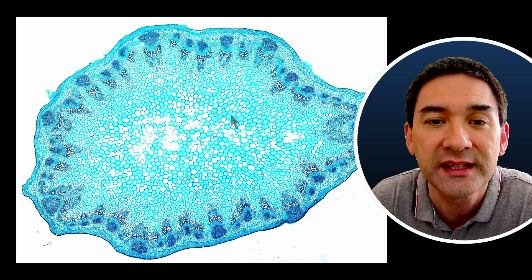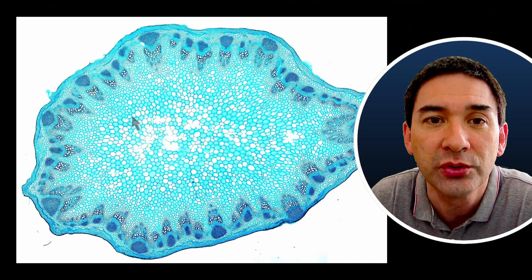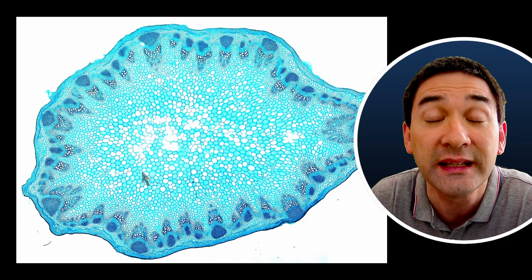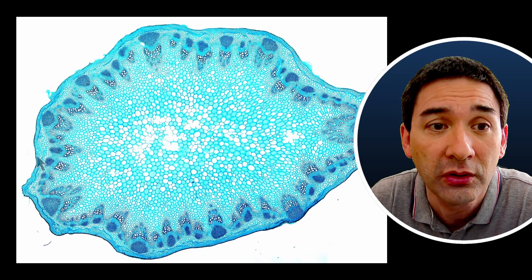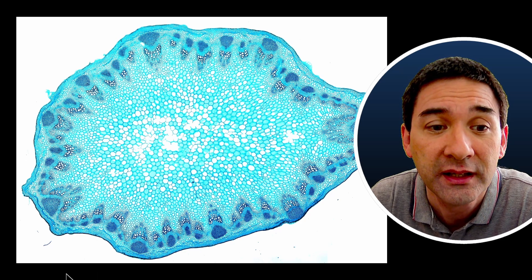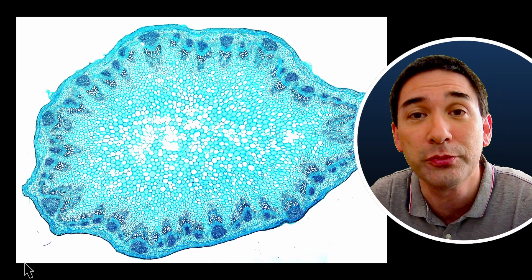Here is the overview image of the sunflower. You can see that the center does not contain those vascular bundles - they are all here on the side. A typical dicot arrangement.